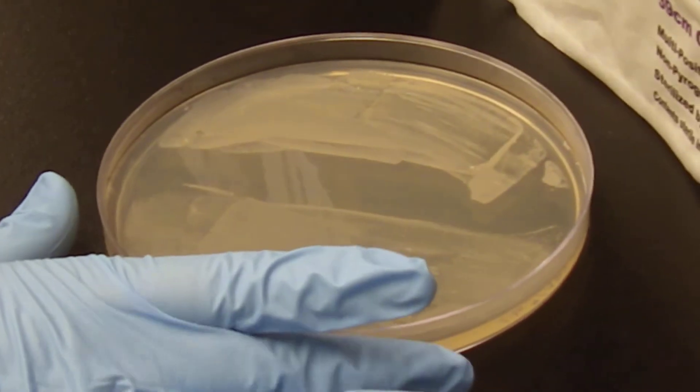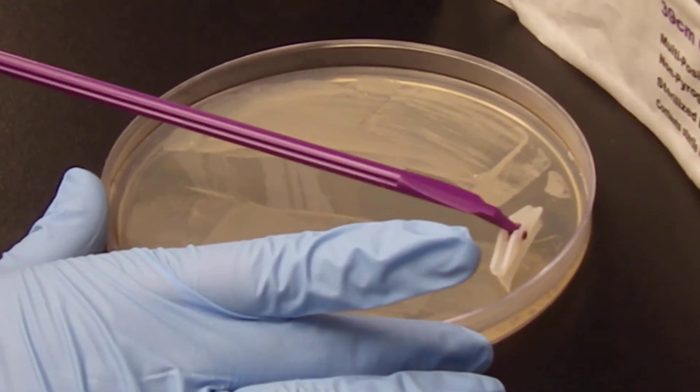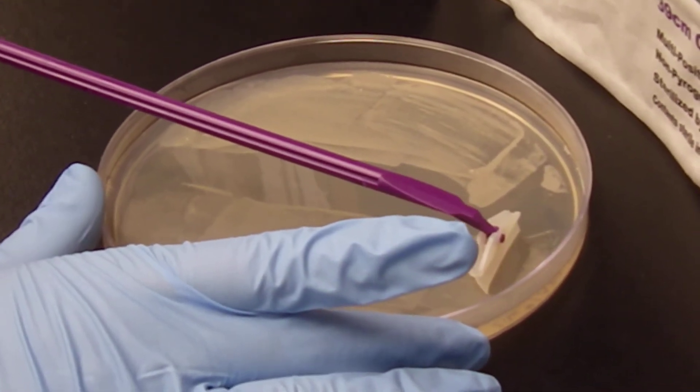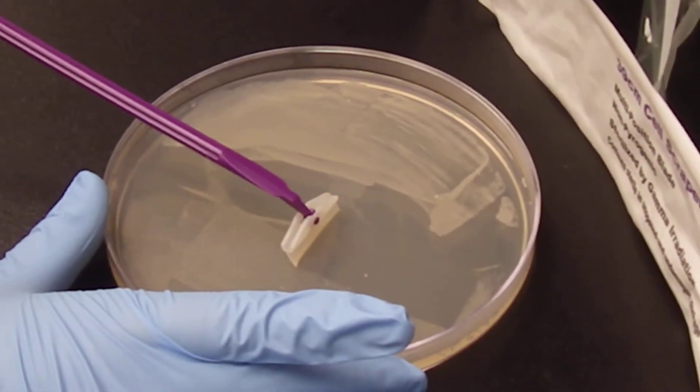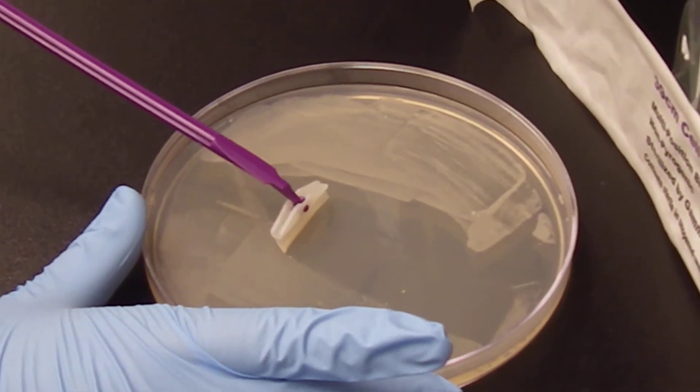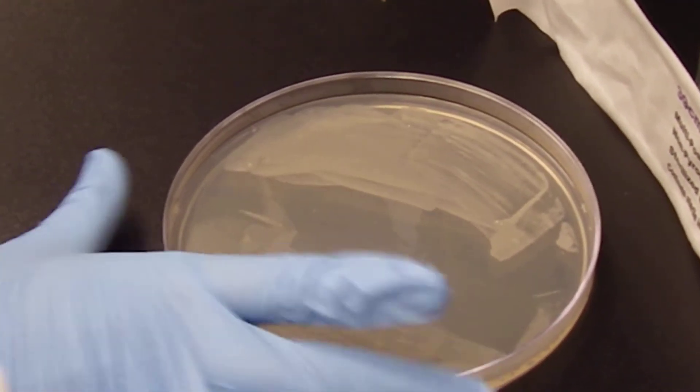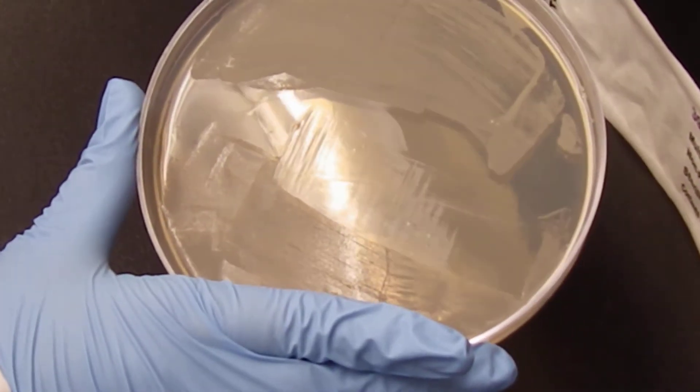Taking it without putting too much pressure on the end, I'm going to scrape the colonies away. You can see I've got a nice amount of bacteria that's come off, and the agar where I've scraped is pretty much clean.